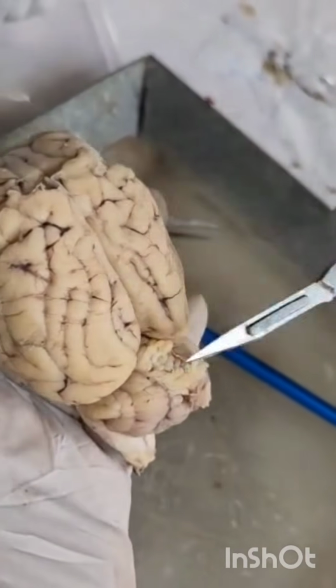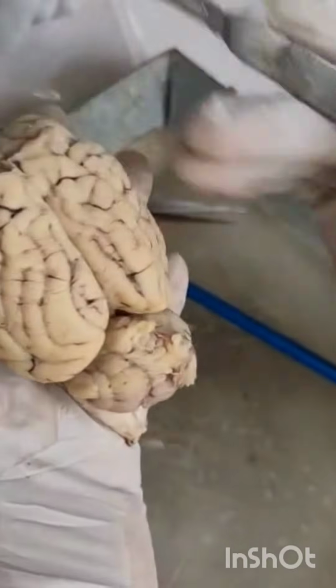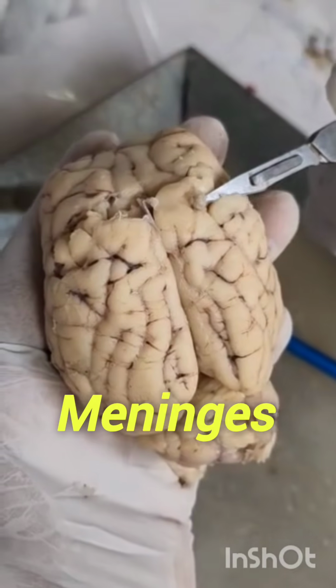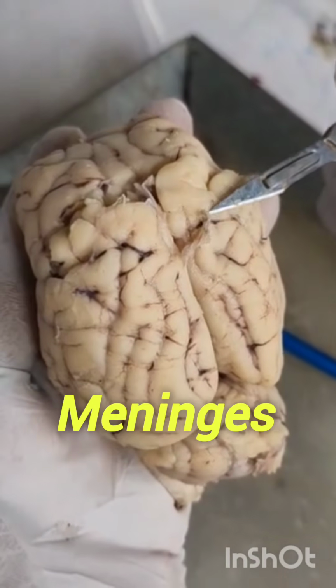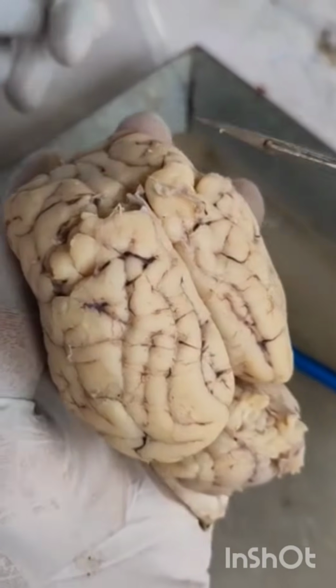Yes, we know that the brain is covered by three transparent membranes. These three membranes are called meninges. They are present one above the other. See, this whitish colored membrane is called meninges. The meninges give protection to the brain.